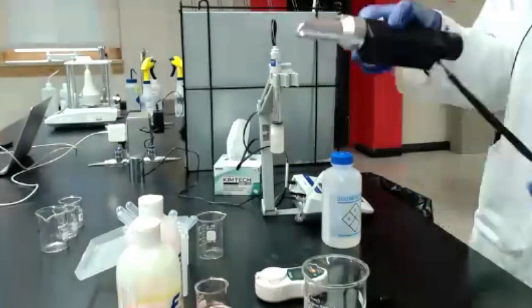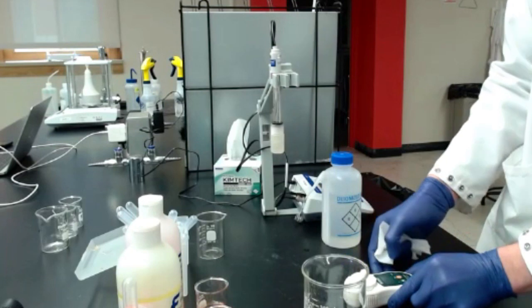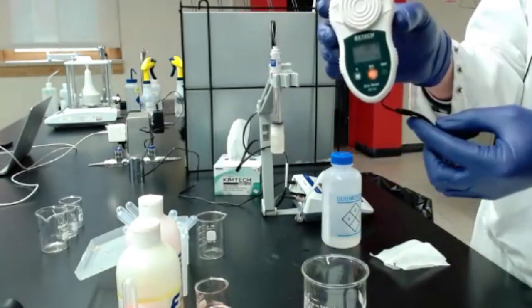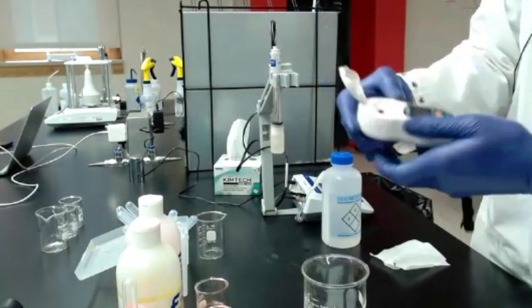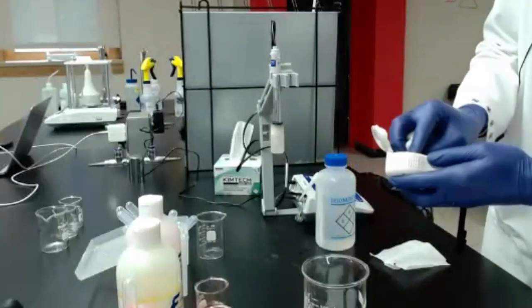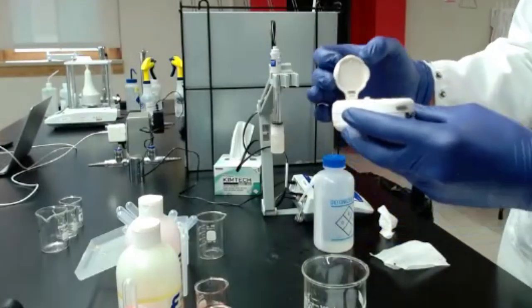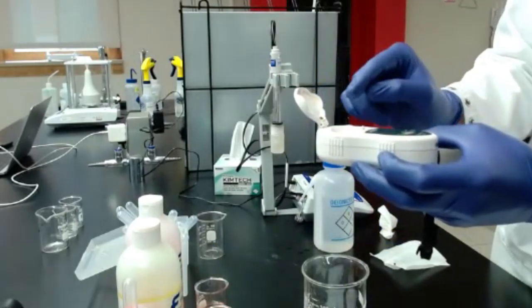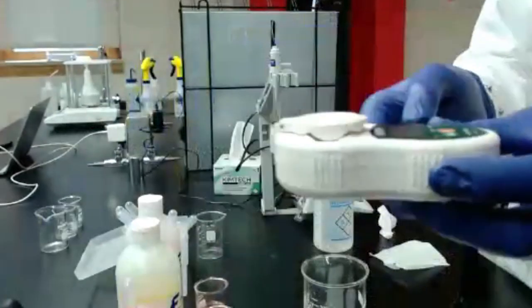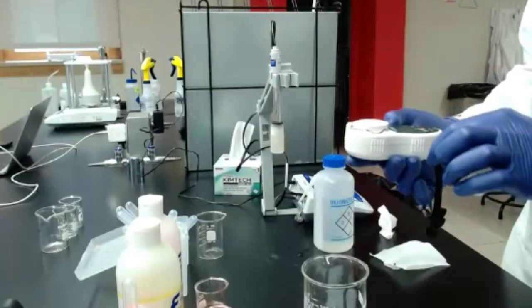All right. I'm going to go ahead and set my manual refractometer aside, and we'll look at the digital refractometer. Does anybody have one of those with you? A little digital refractometer. They're going to operate very similarly. So this one has a little cap. I'll lift it up. I'm going to put a little DI water on there just to rinse it off, clean it out. And then I can reapply the DI water. And with these, it's especially important to make sure, before I close the cap, there are no bubbles on the surface of the liquid. Hard to show with this because I don't want to tilt it too much, but I don't have any bubbles there. It's a little bit more challenging with the juice because there's other stuff in there that makes it a little bit more foamy. Just close the lid and then wait for it to pop up.